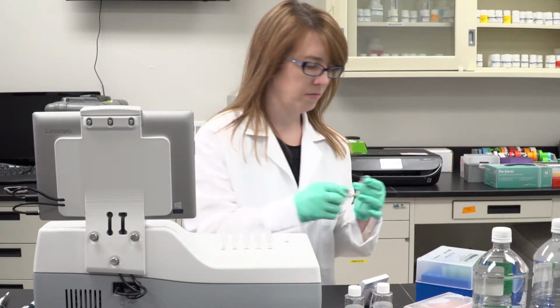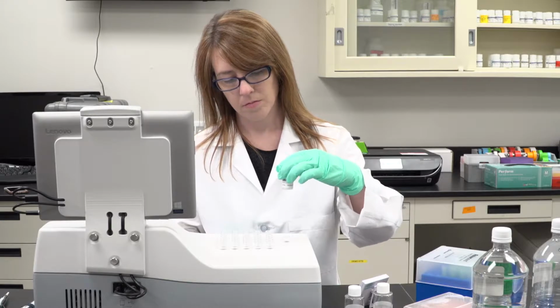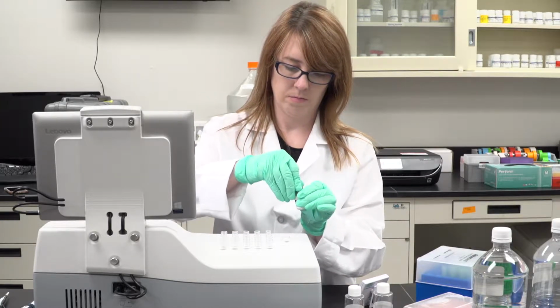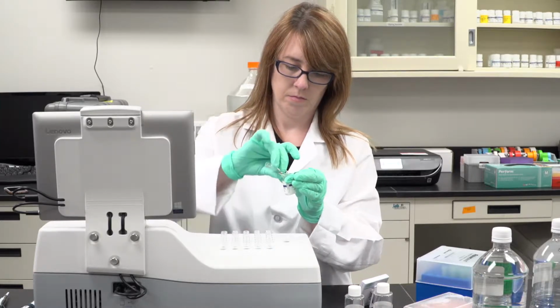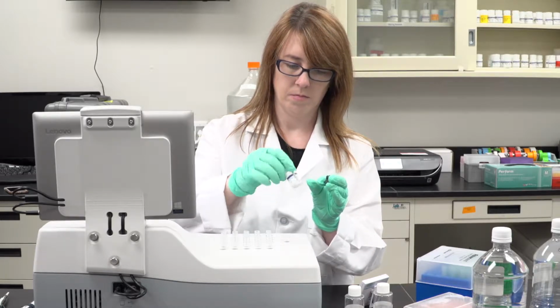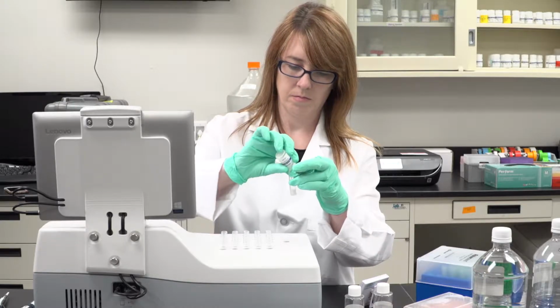Reconstitute a vial of Microtox acute toxicity reagent by removing a single vial of reagent from the freezer. Open the vial with a minimum of handling to reduce warming of the vial. Shake and tap the vial gently to ensure the pellet of bacteria is seated on the bottom of the vial. Take the pre-cooled cuvette of reconstitution solution from the reagent well. Then quickly pour the solution into the opened vial.